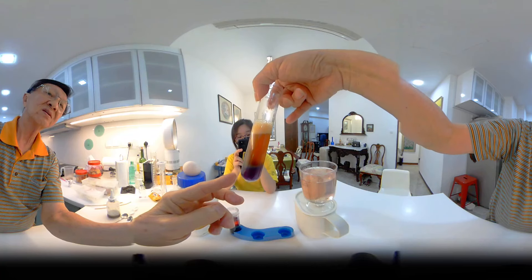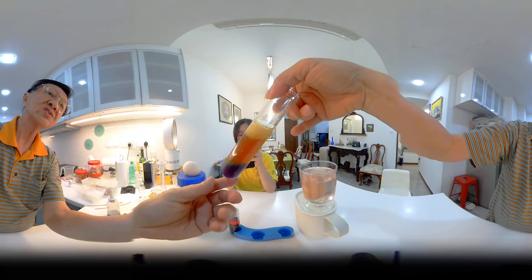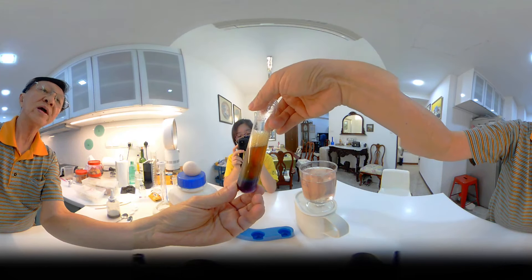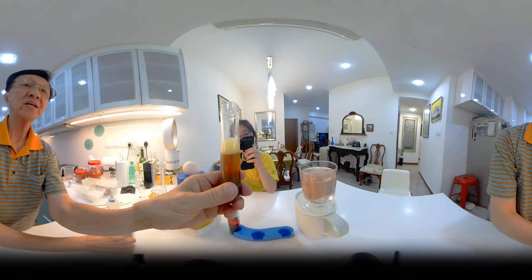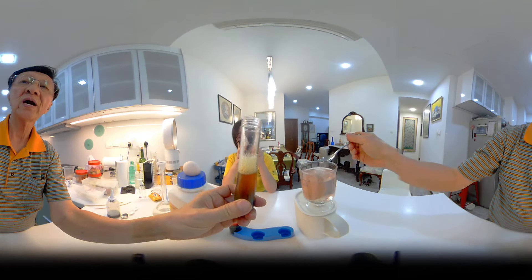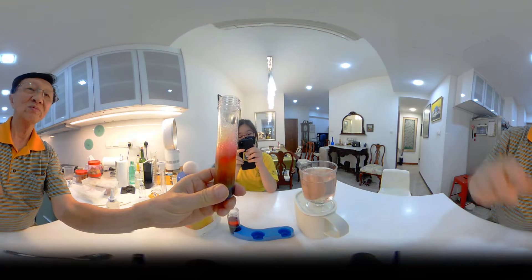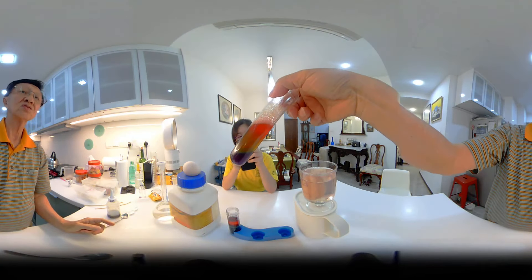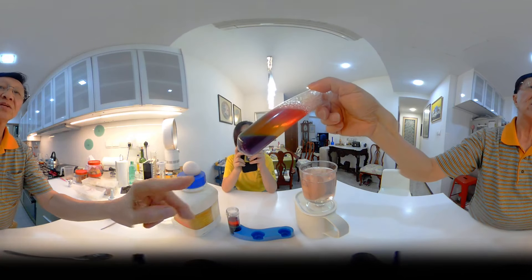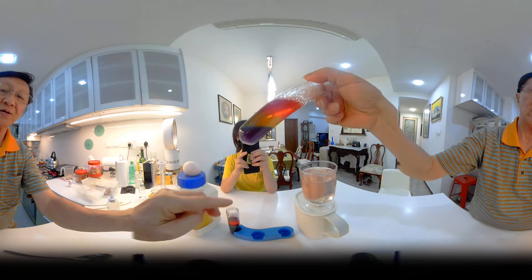It has got green, it has got yellow, it has got orange. Now, if I put more acid at the top, then the top will become red. There are orange and yellow layers, and actually there is a blue layer between the green and the purple.